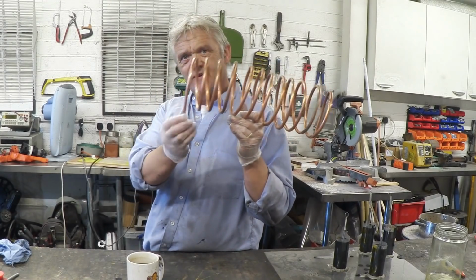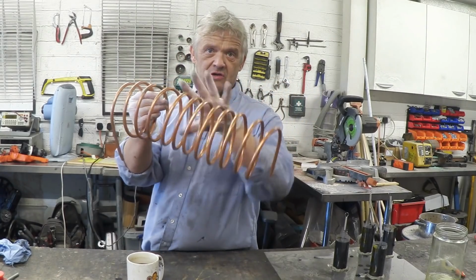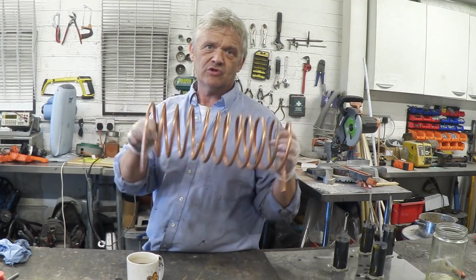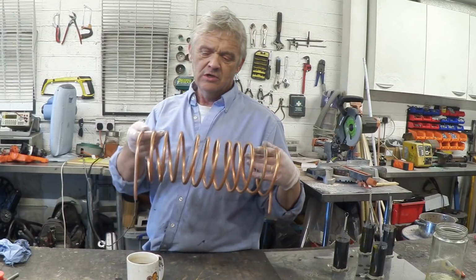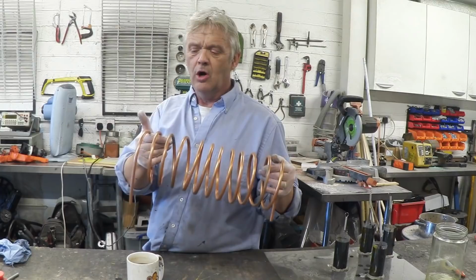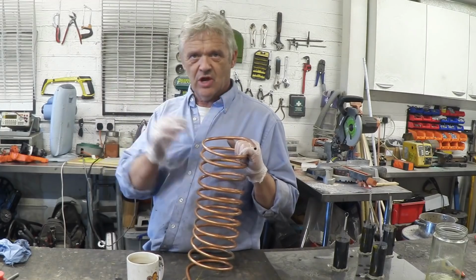Now we connect this to a vessel where we can boil that material. The vapor will come up just like it did in the glass, condense in the air because we've got it exposed to the air, and the liquid will drop out. So that's the core of any still, because the word distillation gets shortened to still. So now we've got our core, a copper coil. What we need is a vessel that we can seal, because it all needs to be sealed, otherwise of course the vapor will just escape everywhere.